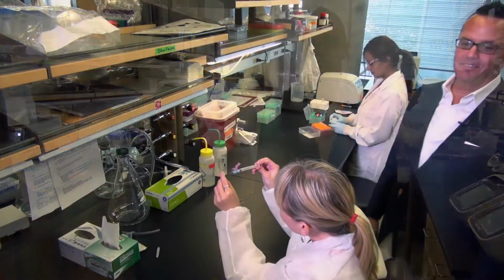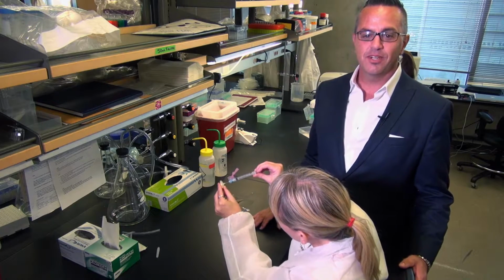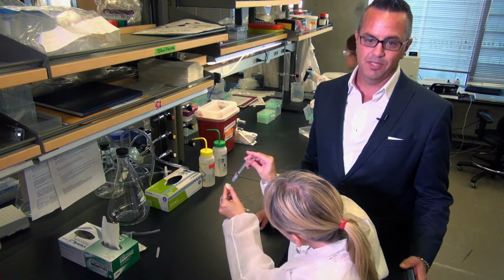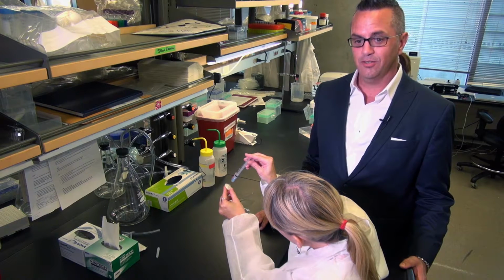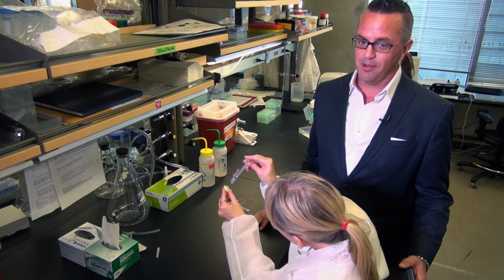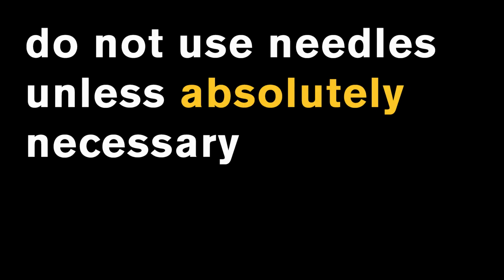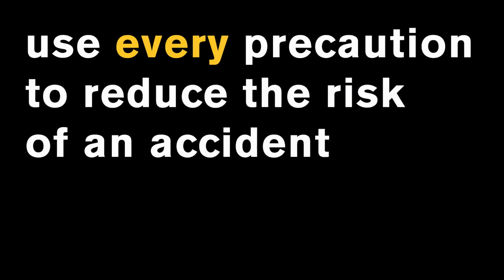If you see someone in the laboratory not wearing the correct personal protective equipment, or not using the right safety equipment, or doing a procedure incorrectly, you should tell them to stop. When working with hazardous materials, do not use needles unless absolutely necessary. Use every precaution to reduce the risk of an accident.